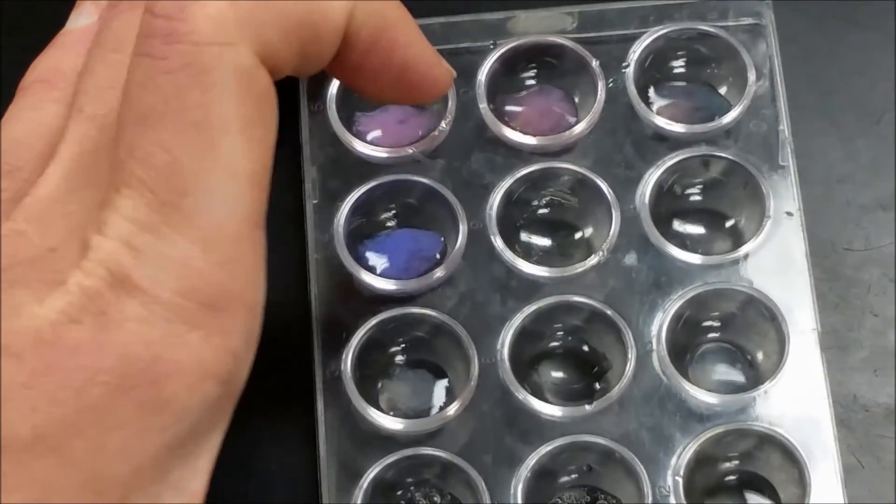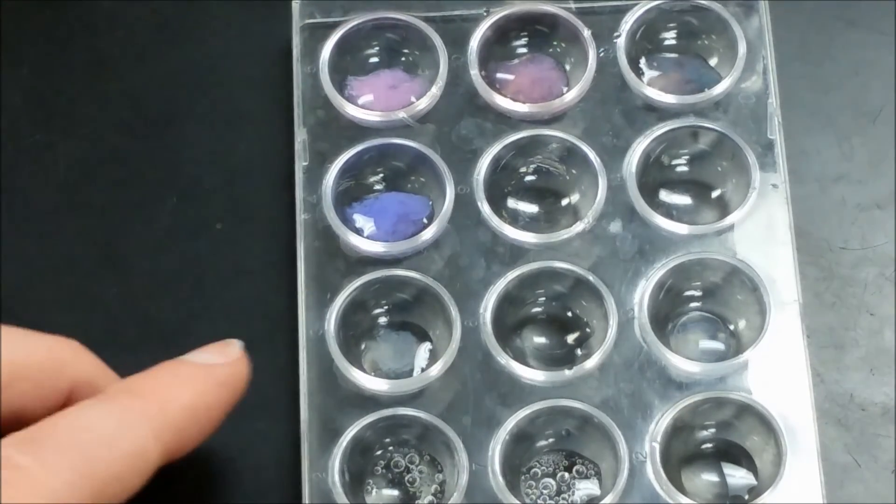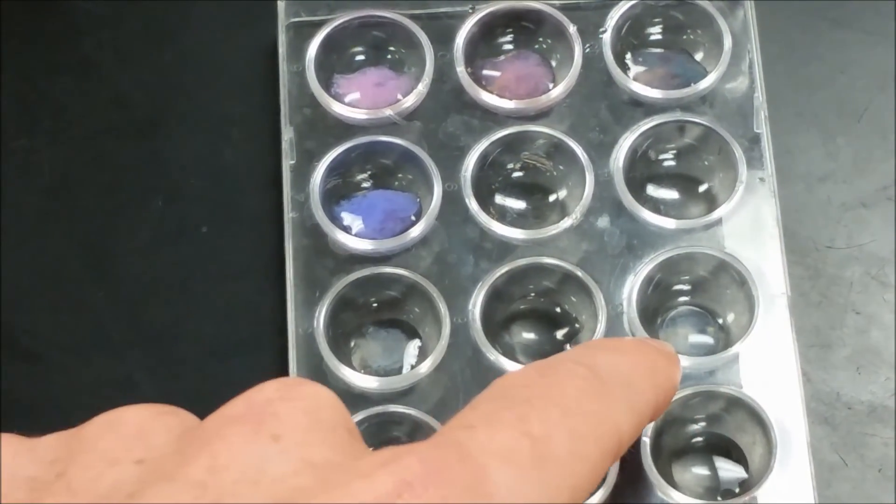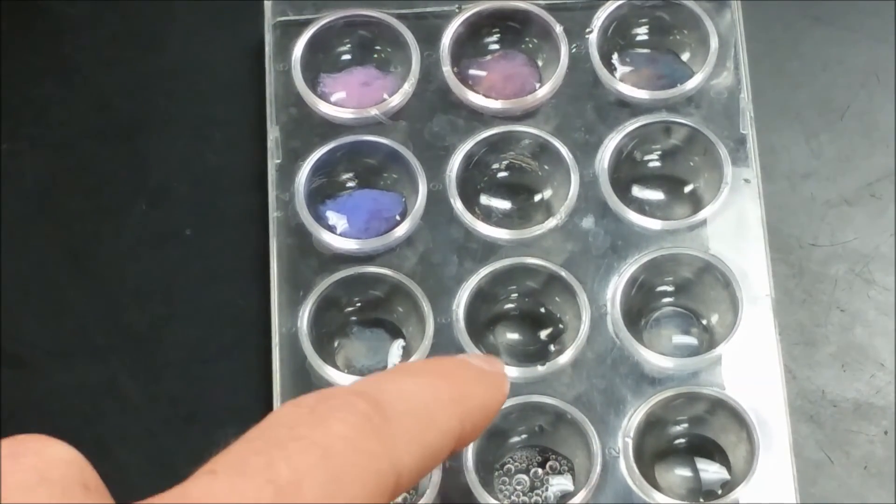Now, let's get rid of the background here. So this test here, you can now see that there is a precipitate for the carbonate and there is a precipitate for the hydroxide, but not for the bicarbonate.